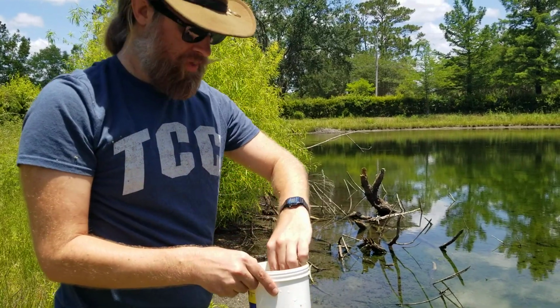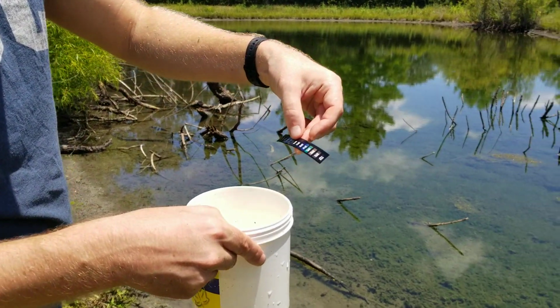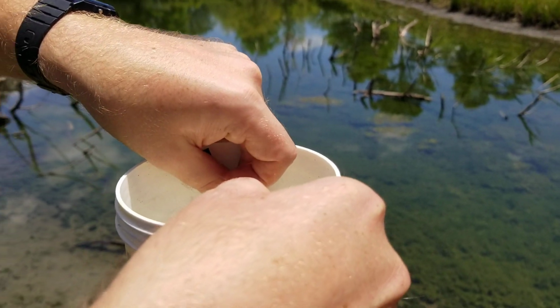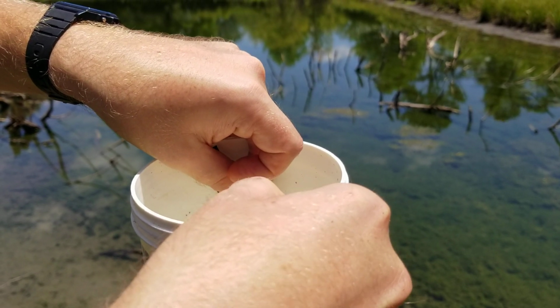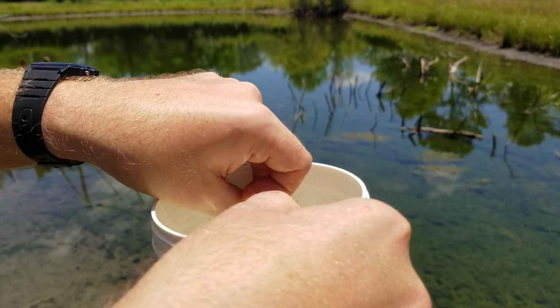Okay, so I think it's been a minute right now. So we're going to take our thermometer out. What we can see is where it's highlighted the most, and it's already fading a little bit. Let me put that back in there. It looks like the water temperature, according to this reading, is between 34 and 38 degrees. This is Celsius.